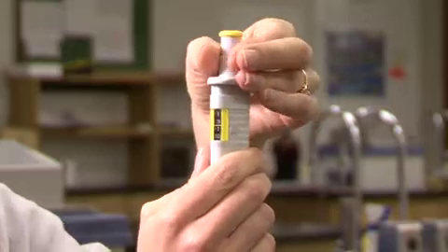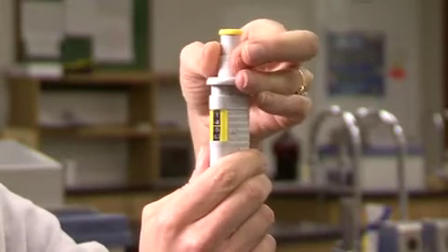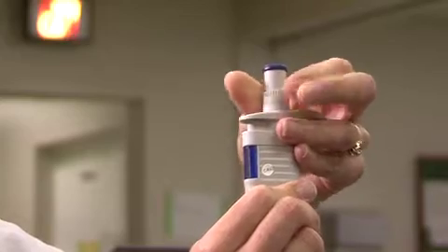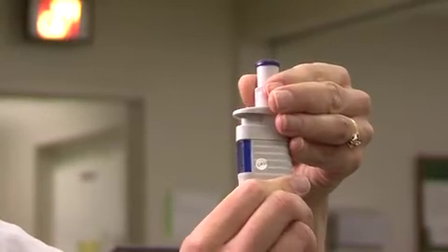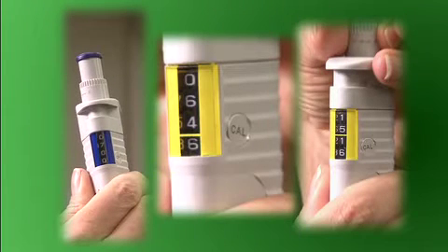the volume adjustment is made by rotating the ridged dial located around the yellow plunger. The clockwise rotation will increase the volume while a counterclockwise rotation will decrease the volume. The numerical display of each micropipette makes it easy to ensure you will be dispensing the proper volume. But as each pipette may have the decimal represented differently, you must become familiar with how to read that value properly.